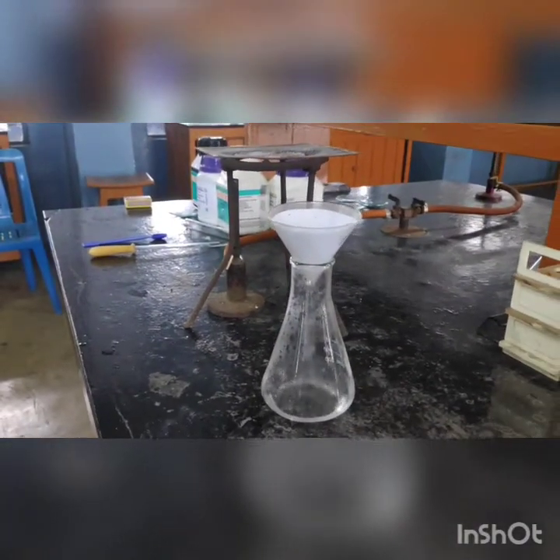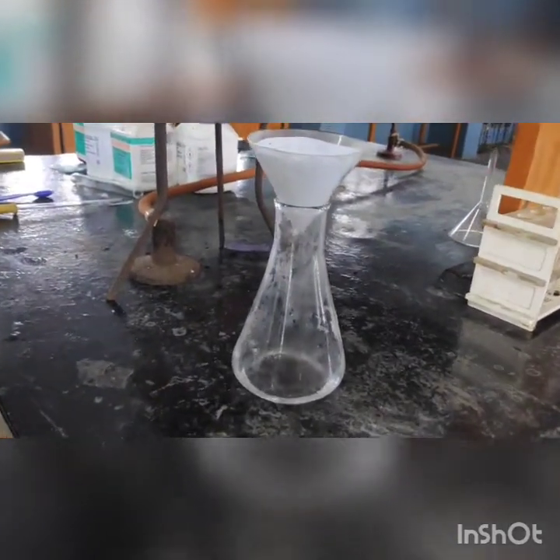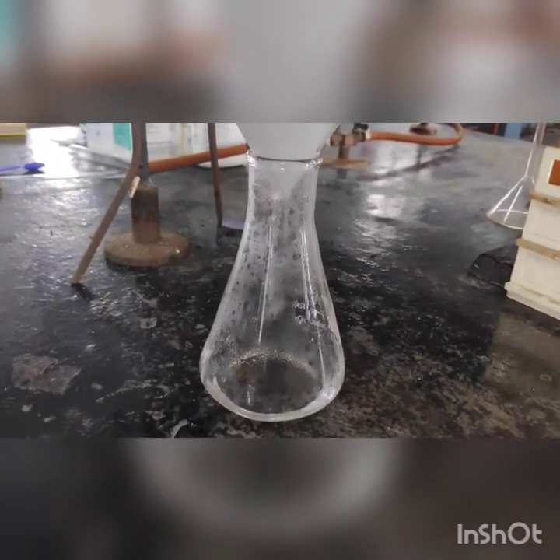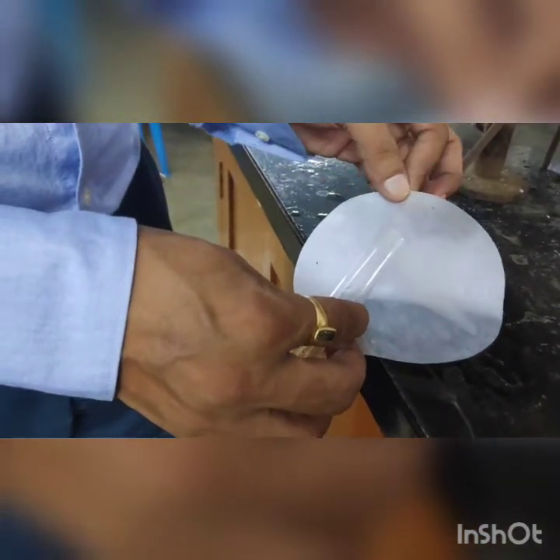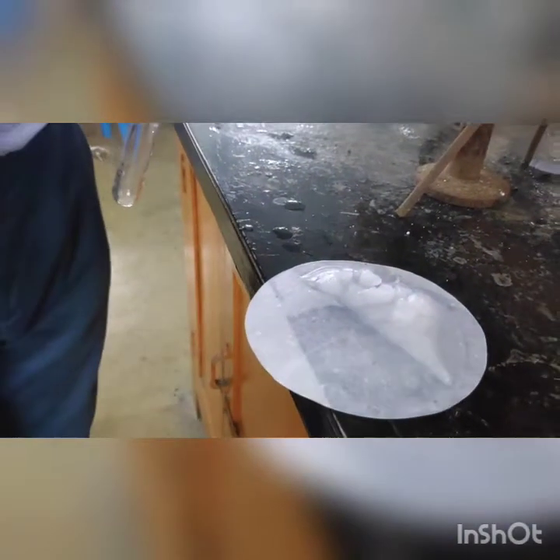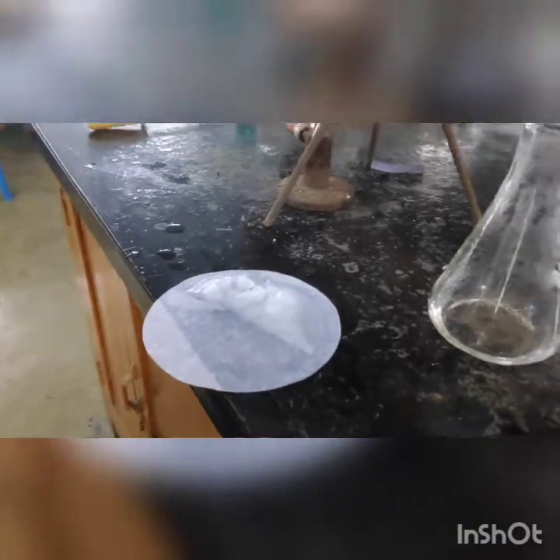We will wait till the solution cools before proceeding for the tests. The filtrate will be used in separate amounts to test for the different anions. You can see the precipitate on the filter paper — this will be collected for the analysis of the cation, for the systematic group analysis taught in class.